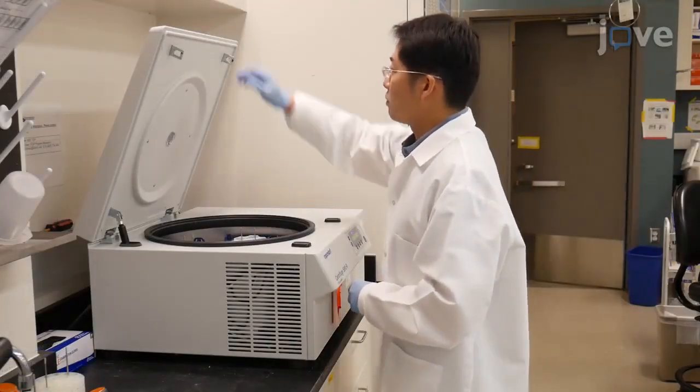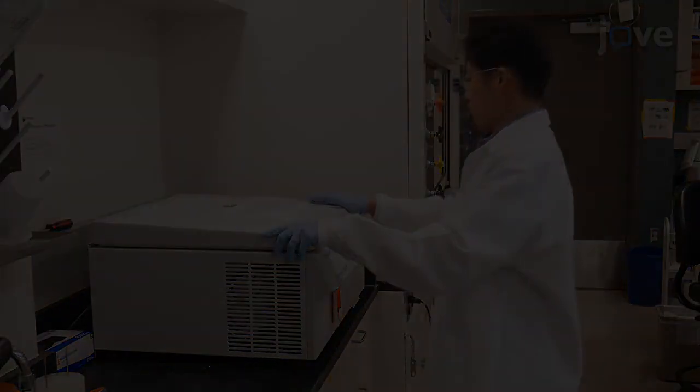After this, collect the tumor pieces via centrifugation at 200 times G.